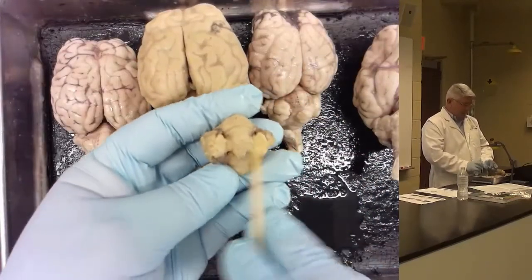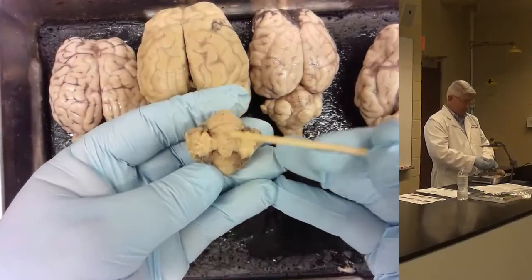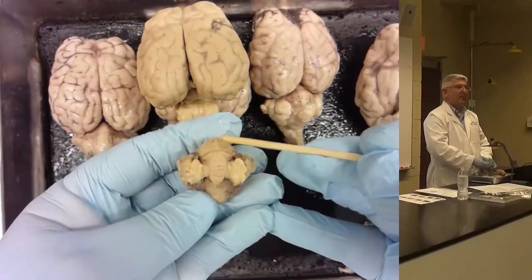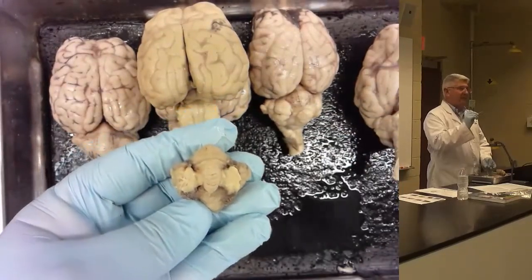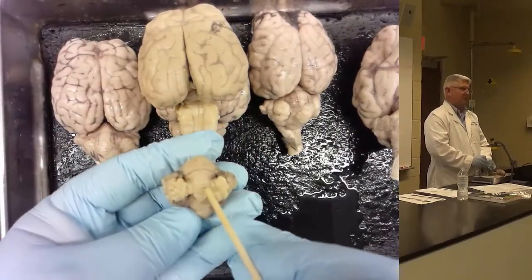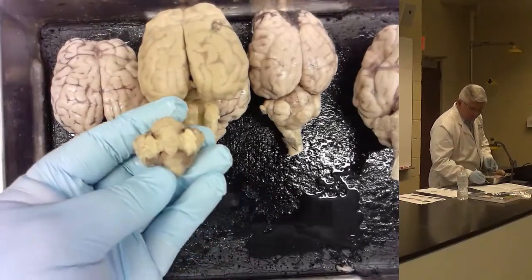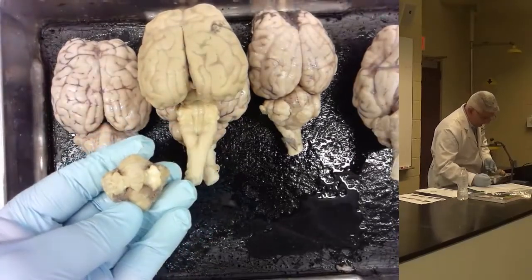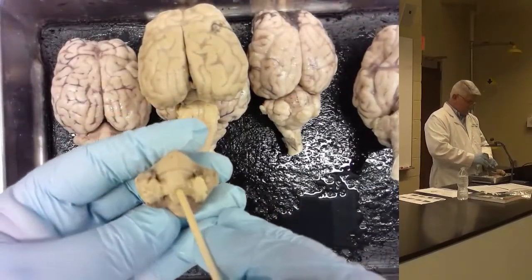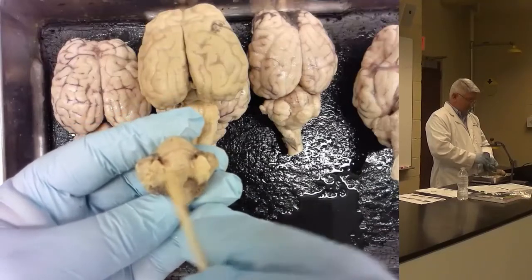On a cerebellum that's been cut like this, what is the center part here? The ring that goes all the way around the center. The vermis. Except for the part right in between the middle peduncles, which is called the nodule. It's on there, first page, number 6 under B, nodule. Kind of looks like a nodule. It's like a button sticking up there. And there are middle peduncles on either side.